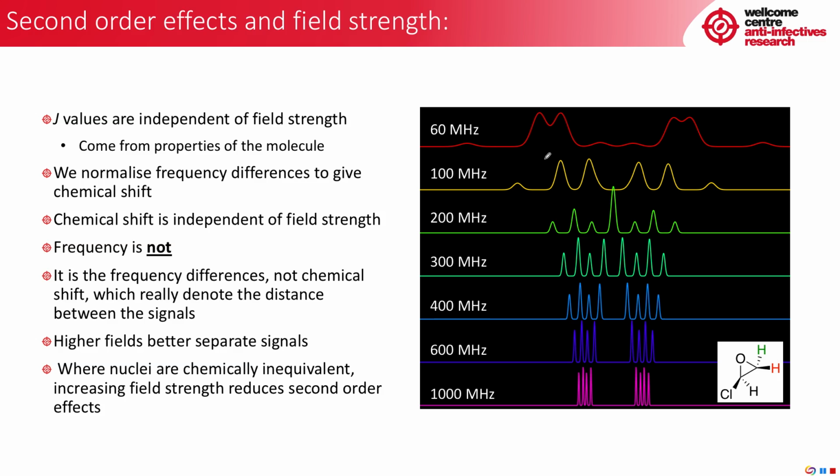As we go to 100 megahertz, it changes a little bit. It's narrower, sharper. It's still ultimately second order in nature. When we get to 200, we're starting to see a shape kind of like we saw for the fluorine before, and it's a bit more distinct and a lot narrower. And then by the time we get to 300, we're seeing quite distinct roofing doublets. And this one we've seen before at 400, and these signals are quite distinct, and you can take J values and so on from them. And then as you increase up to 600 and eventually 1000 megahertz, you can see that what happens is the signal gets narrower, and actually the degree of roofing is reduced as the frequency difference between the two signals increases.